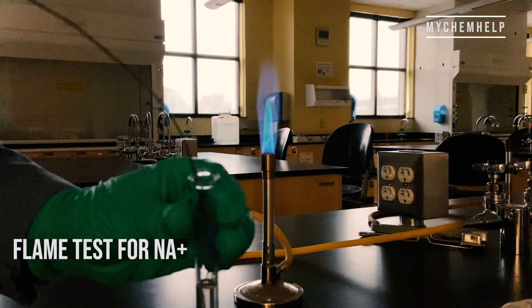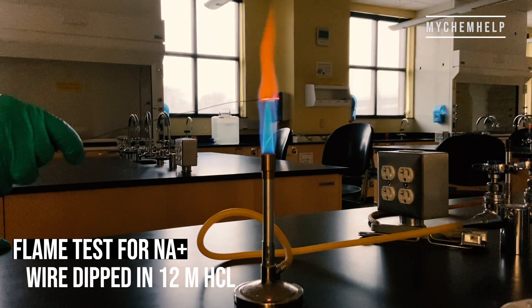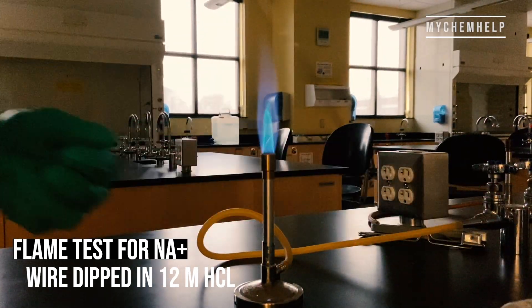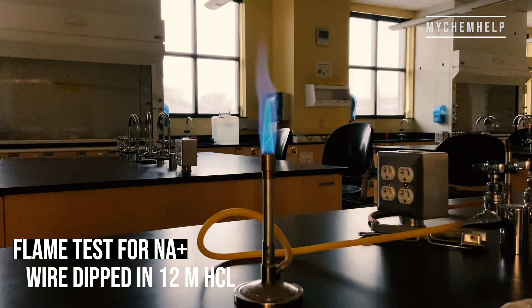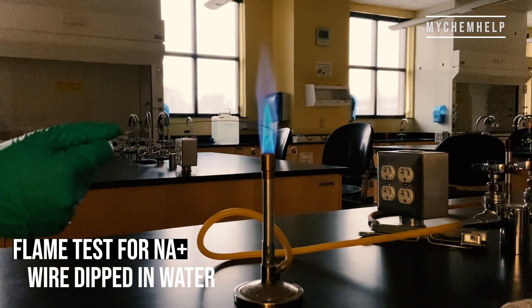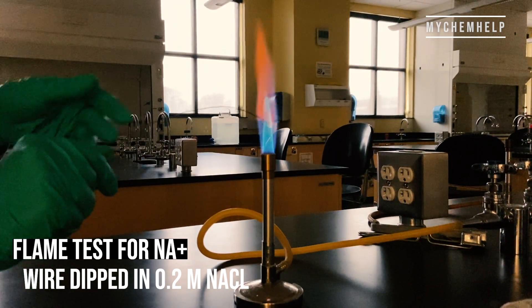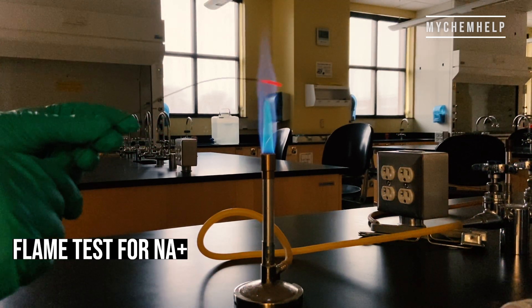For our last cation test we are doing a flame test — this is for sodium ions. First I'm cleaning the nichrome wire with 12 molar hydrochloric acid, which makes a really cool flame. I'm going to repeat that until the flame is colorless, basically back to that blue color. Here's the wire dipped in water — not much is happening. And this is our 0.2 molar sodium chloride solution. You see that really bright yellow flame in the middle? That's exactly what we're looking for — positive test.